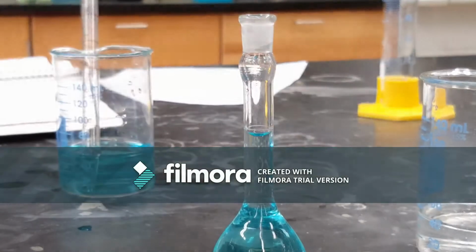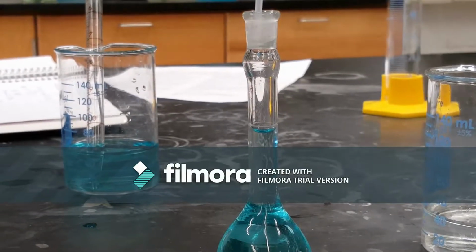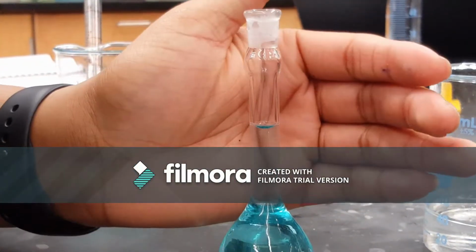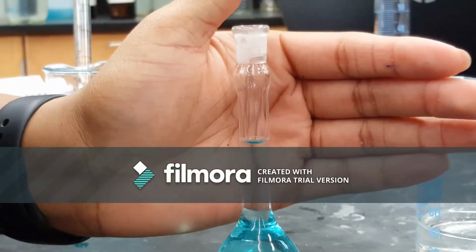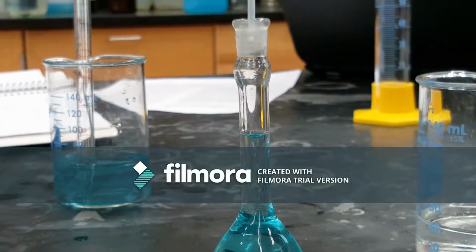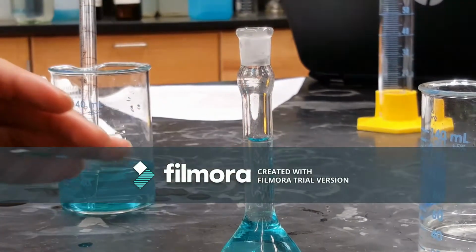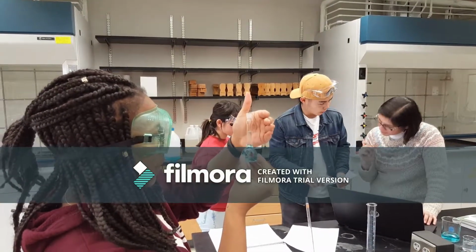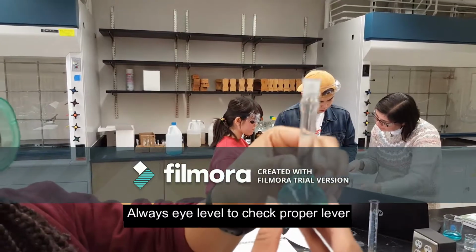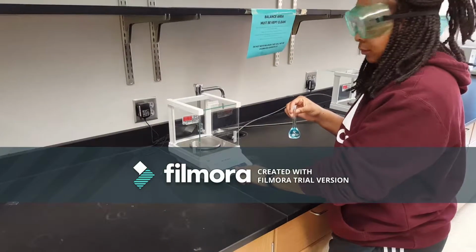Just a little bit more. Like another drop. All right. And go.